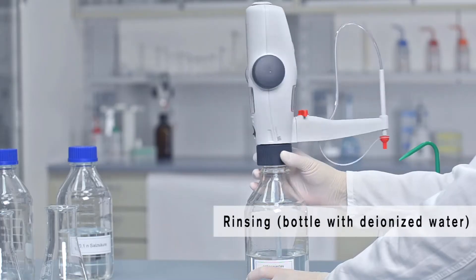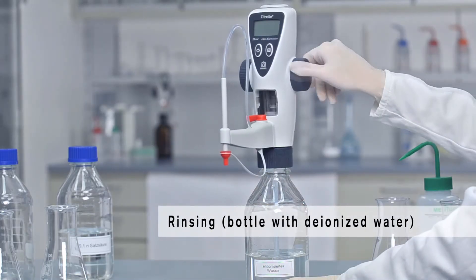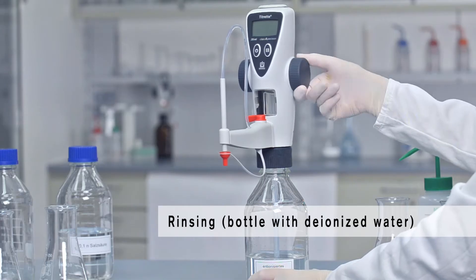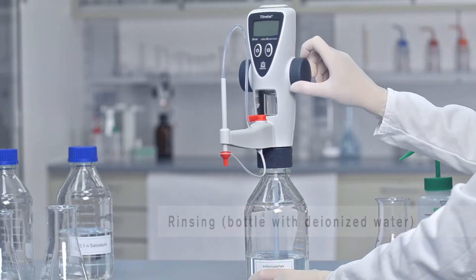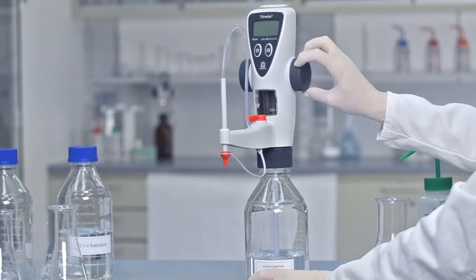Attach the Titrette onto a bottle with deionized water. Then fill and empty it completely several times.